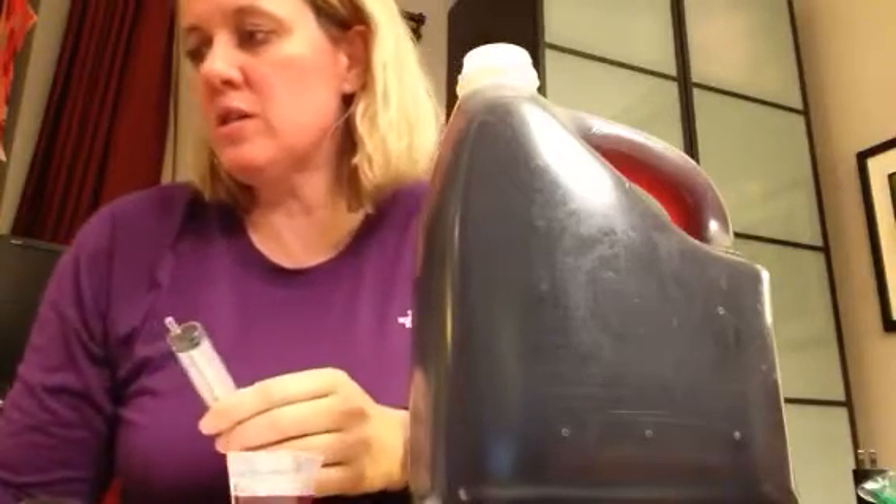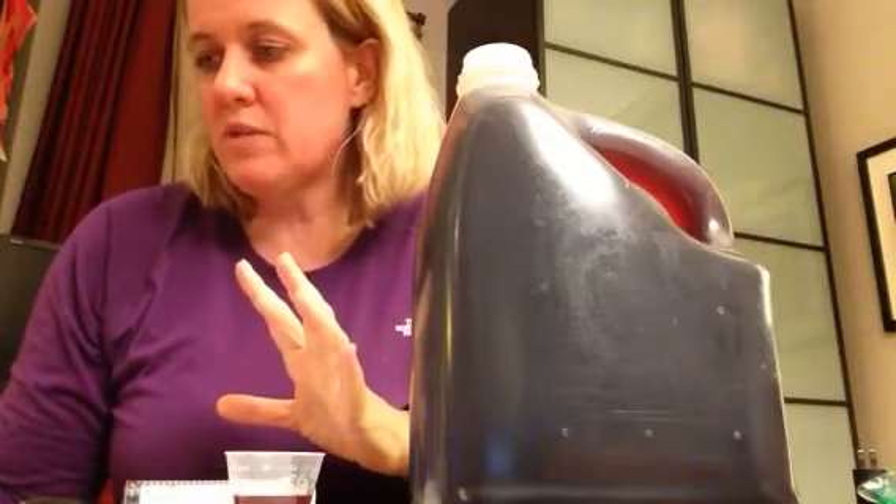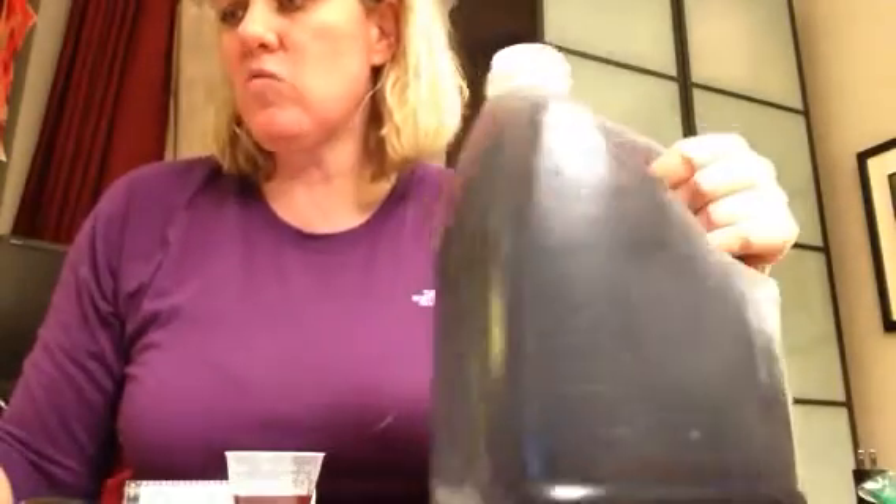Of the wine or juice into the cup. Red solutions may be measured into a larger clear vessel, and we can put distilled water in so that we can dilute it. So that's what I'm going to do with this particular one. I'm going to go get some distilled water and put it into a larger clear vessel, and then we're going to move on from there.